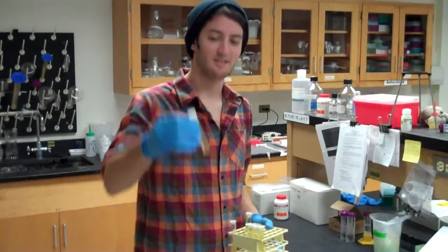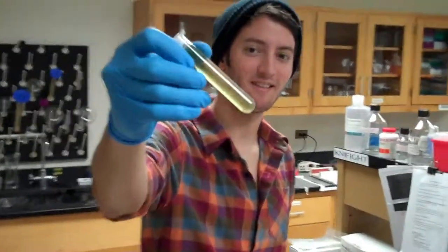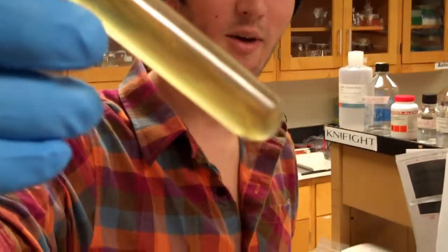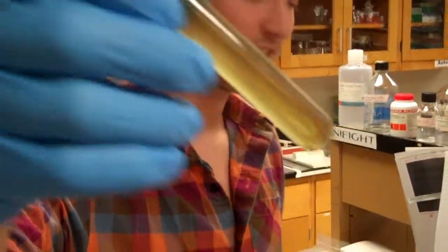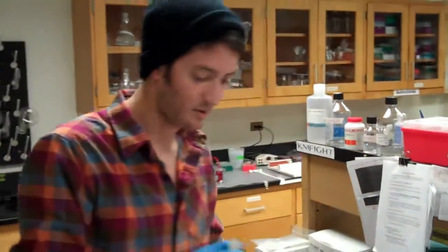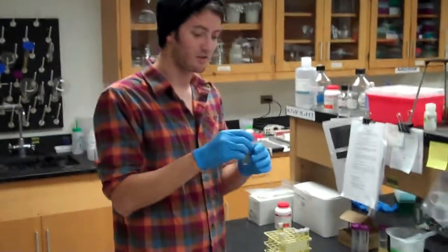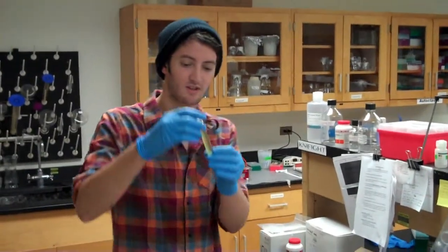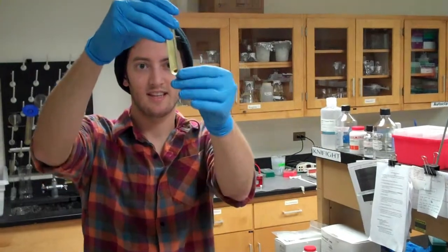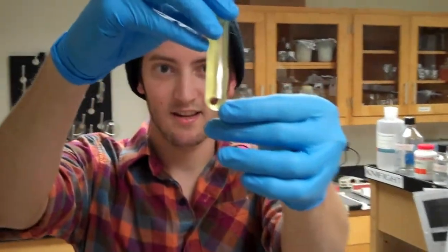How's it going? So on this episode of Vaccine's Lab, we're going to talk about North Korea. I'm just joking. We have our samples from the centrifuge. They've been spinning for 21 hours. We let them spin overnight in the cold centrifuge. Now what we're going to do is discard the supernatant, which is the liquid on top. If you can see that black dot right there, that's the pellet. We're keeping all the pellets from each tube.